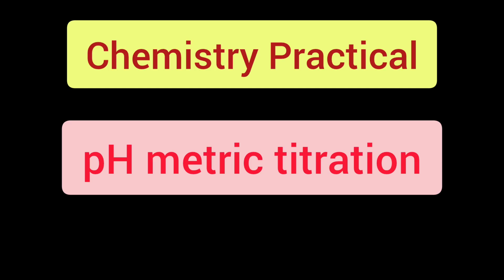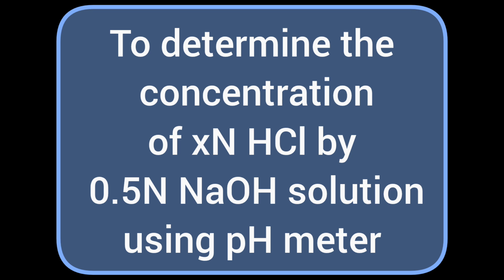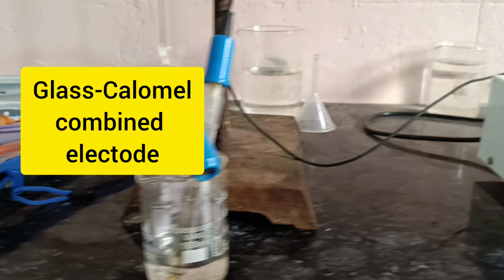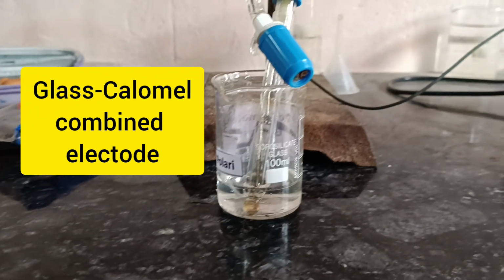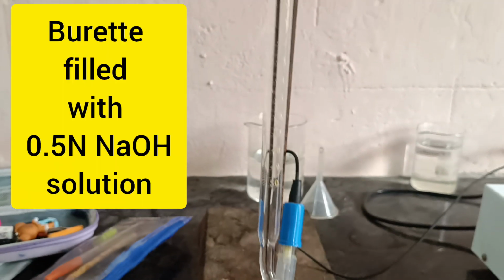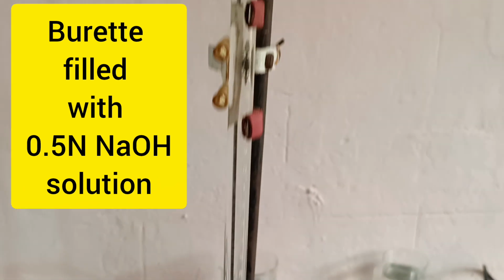Hello everyone. Today let us take the pH metric titration, in which we have to determine the concentration of X normal HCl using 0.5 normal standard NaOH solution. The pH meter instrument is connected with the glass and calomel electrode, and in a beaker X normal HCl is taken and a burette is filled with the standard 0.5 normal NaOH solution.